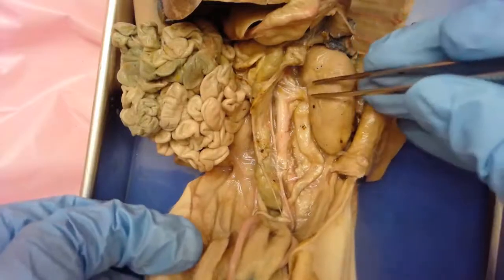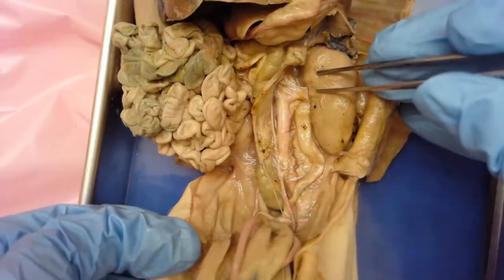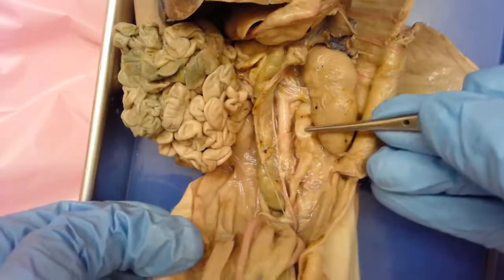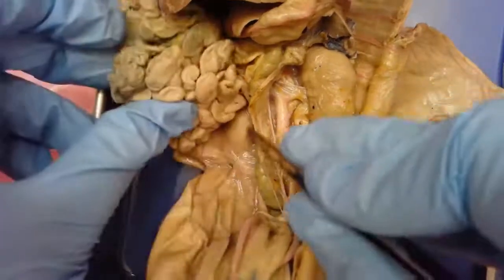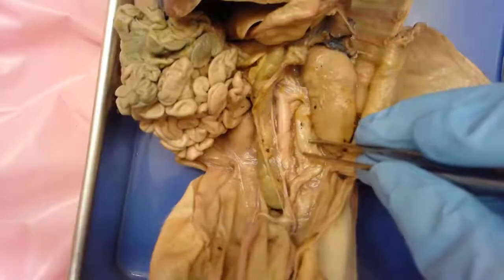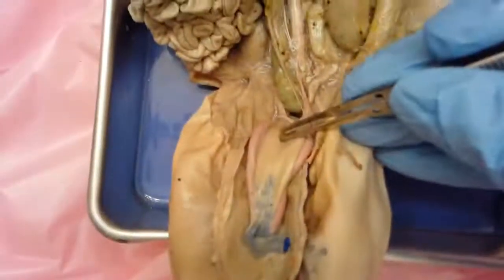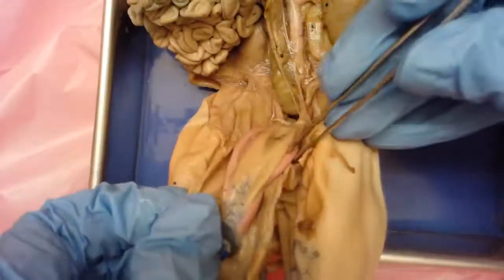Once the blood is filtered, the items that were filtered out — that waste product — will form urine. That urine leaves the kidneys through this tube here called the ureter. There's one ureter on either side. Those ureters lead down to the urinary bladder.